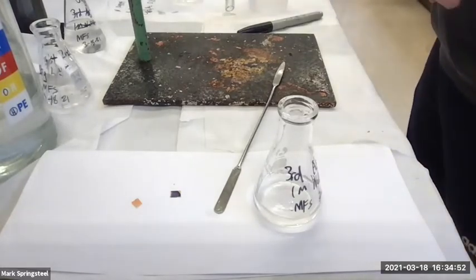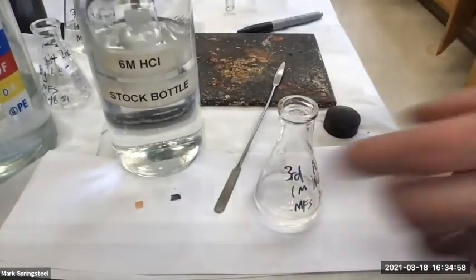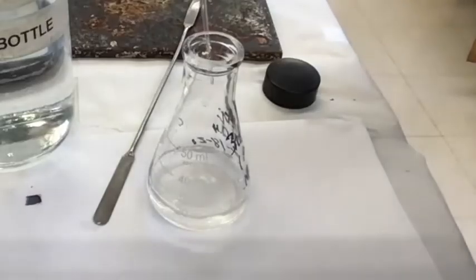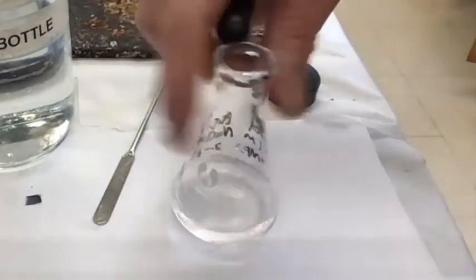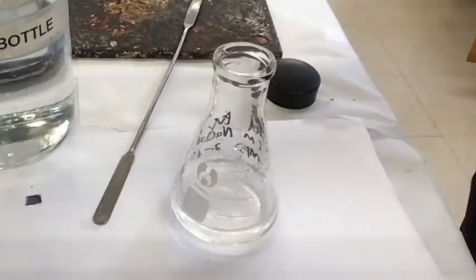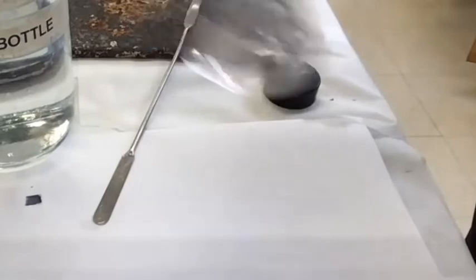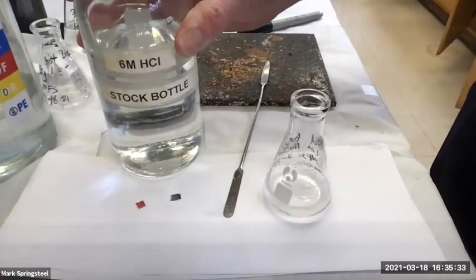6 molar HCl. Got it, 6 molar HCl. So we should see precipitate forming right away and then dissolving. Can you guys see the flask well? Yeah, you can see it well. Ooh, I'm not really seeing precipitate. Last time I think I did about 3 squirts of 6 molar HCl. So I'll do 3, swirl, and check. Not seeing anything, but I have to make sure I did make it acidic before I can say there's no precipitate. Oh, I made it acidic. Okay, great.